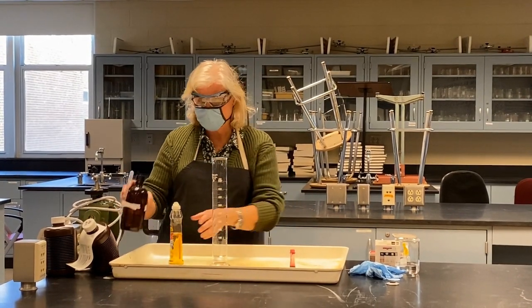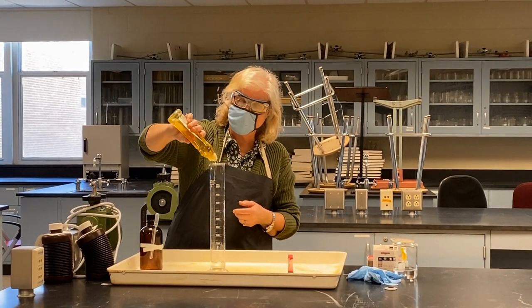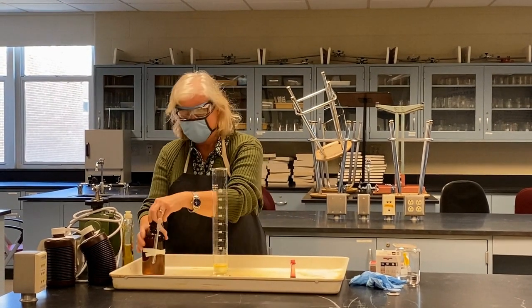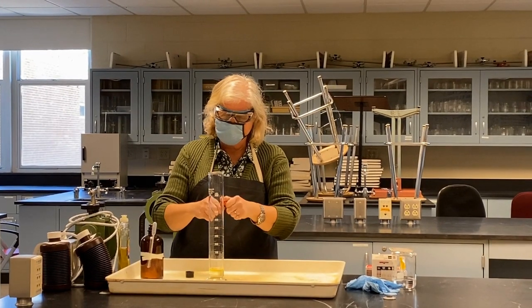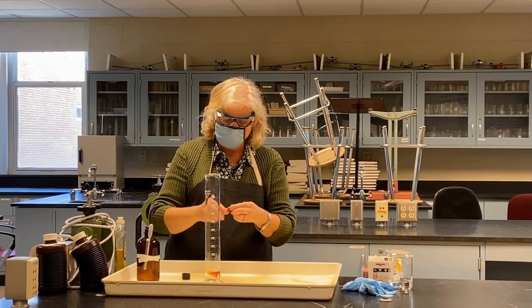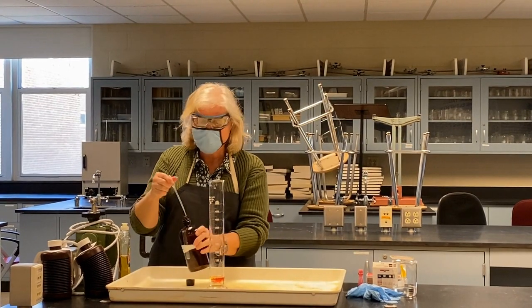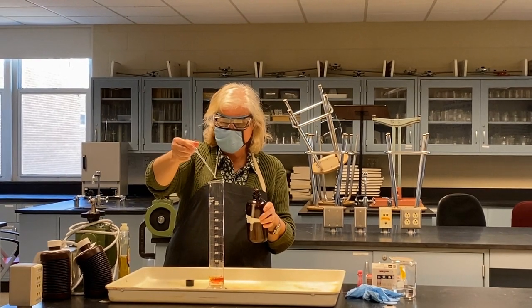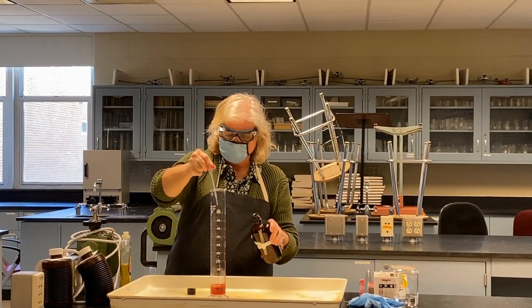Well, let's make it interesting and speed it up a little bit. Oh, let's not have that fall over. I'm going to add some dish soap so we can see some bubbles. Still nothing happening. And also I'm going to add some food coloring just for color. So let's get it a fun color. Still nothing happening. Well, let's speed this reaction up. It's very, very slow. Let's add a catalyst. I'm going to add potassium iodide. So as I add the potassium iodide, you can see some bubbles are starting to form here.